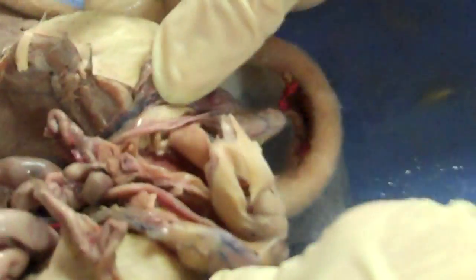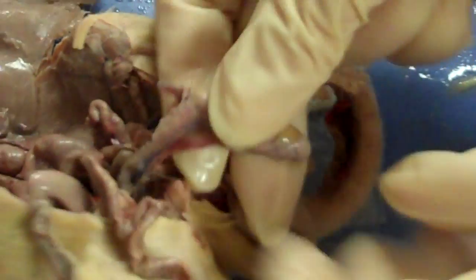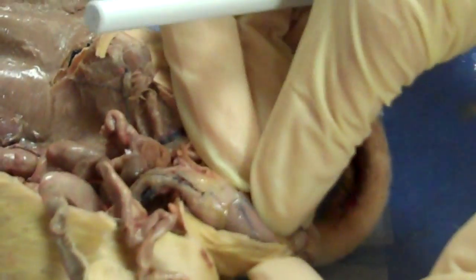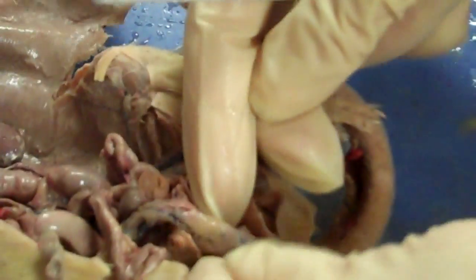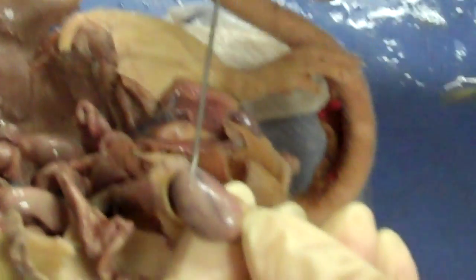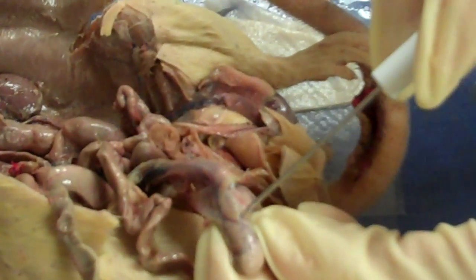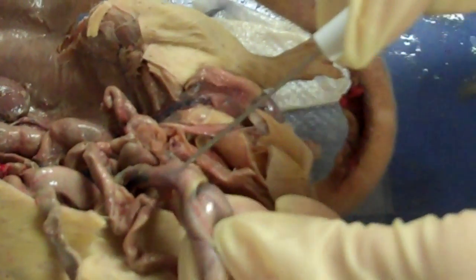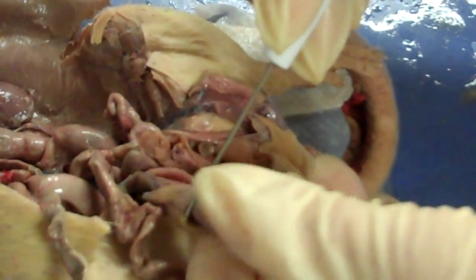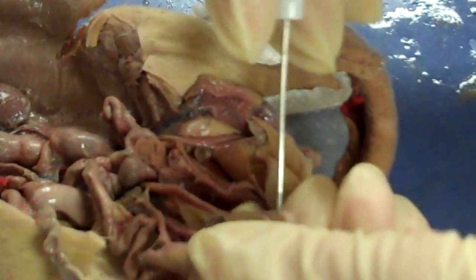This is a male, so we have the male reproductive organs. These are the testes that would normally be housed inside the scrotum — we took them out. The testes make sperm and also make testosterone. Surrounding and wrapped around the testes are the epididymis, which store the mature sperm.